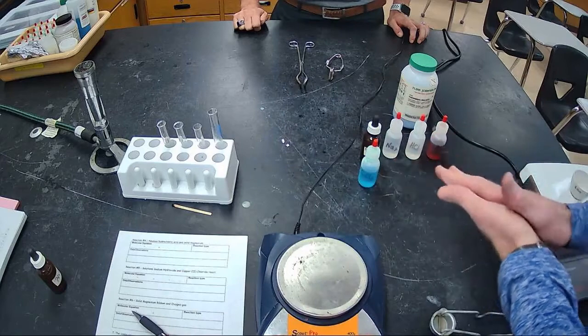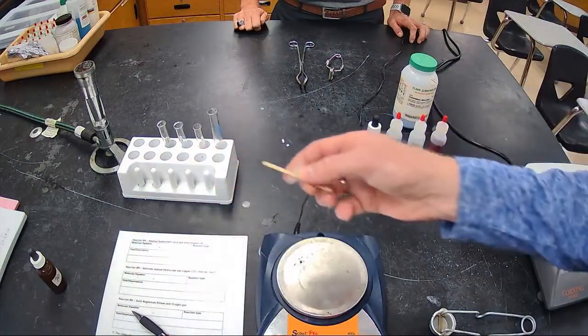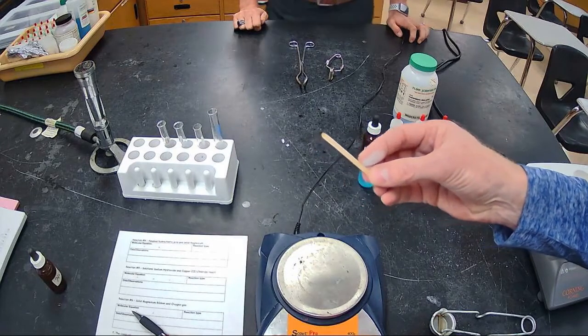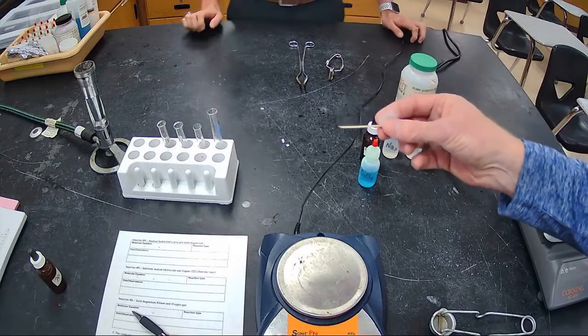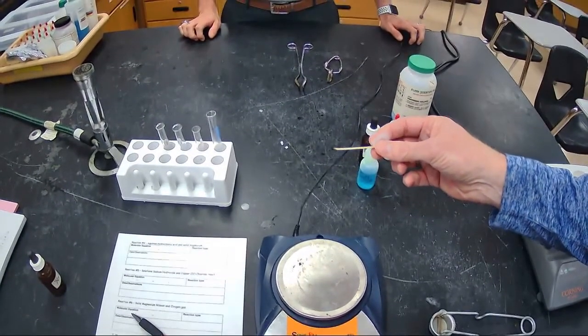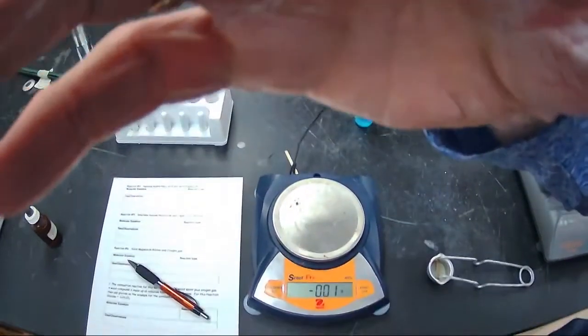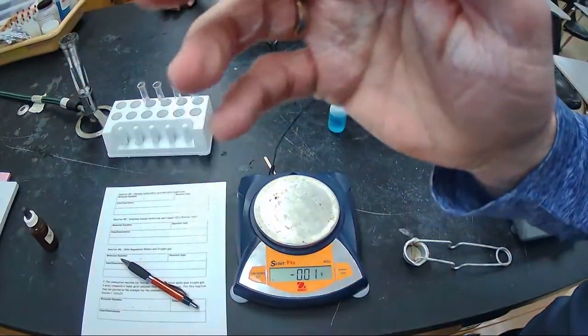And reaction number 7, we've already seen, which is our wooden splint. We burned it. We know what happens with fire and wood, and we burn those so you can get that reaction there. Make sure that you write down reaction number 7. Okay. And lastly, move this back a little bit so you can see our last result.